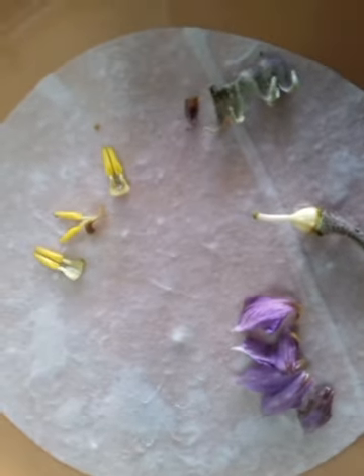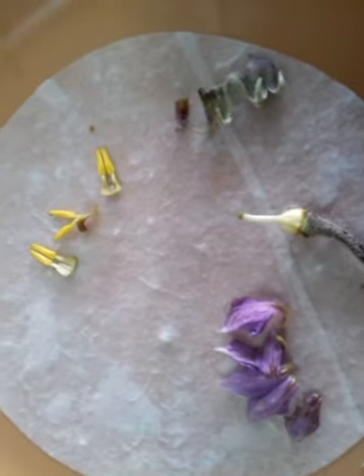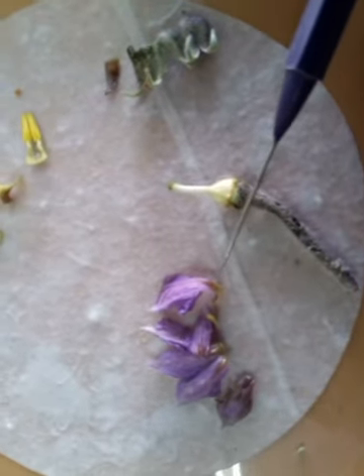This is another dissected flower of that same family. This is also from Solanum melongena. This is what we call brinjal in common terms. Now here you can see the sepals, gamosepalous, that is united sepals, and it is also gamopetalous. Both are united. I have dissected it, but because they are inseparable, I have to tear it off.